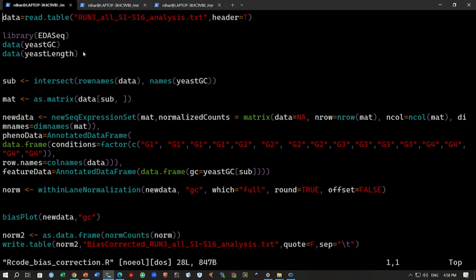Okay, so, one thing I should mention now is that the data set that we are working with is a yeast data, okay, Saccharomyces cerevisiae data. So, we can utilize this yeast GC content, yeast length data. So, this yeast GC, yeast length is very simple, right. What it is looking at is the GC content of the genes as well as the length of the genes, right. So, we need this GC content information if we want to normalize based on the GC content. We can also normalize with the length data, but for this purpose, for this hands on, we will just focus on the GC content based bias correction.